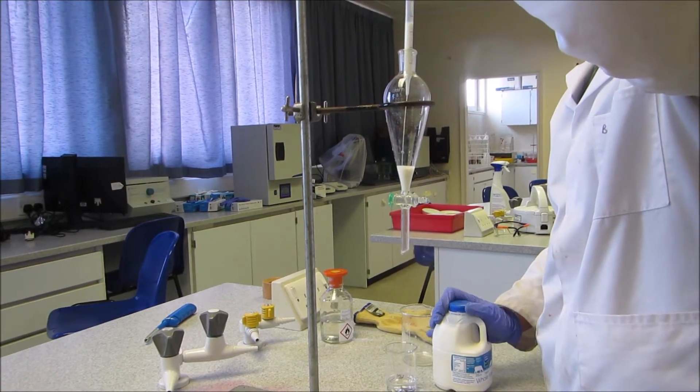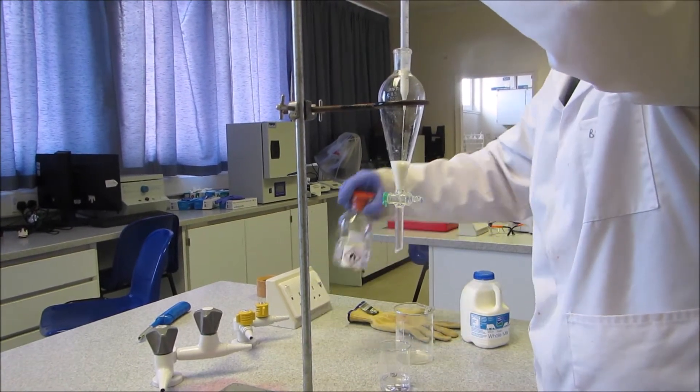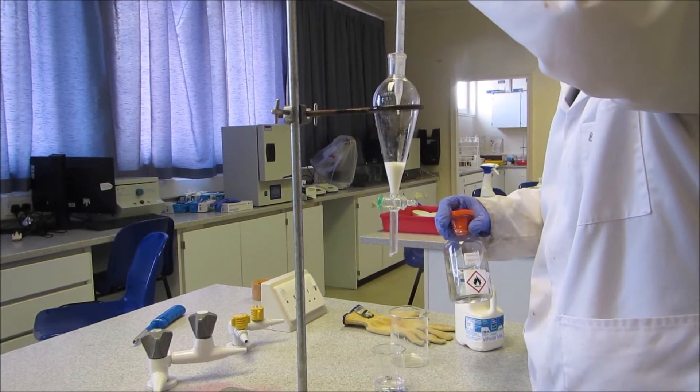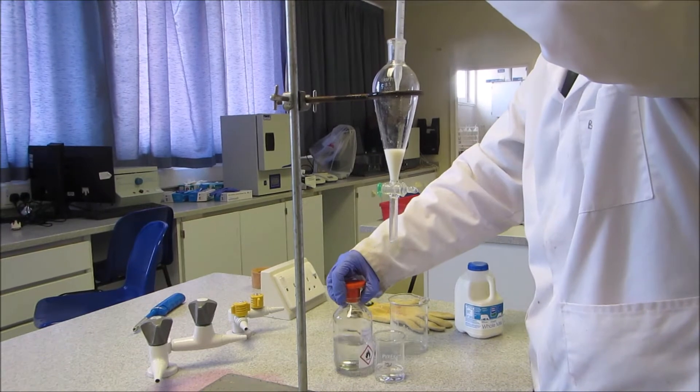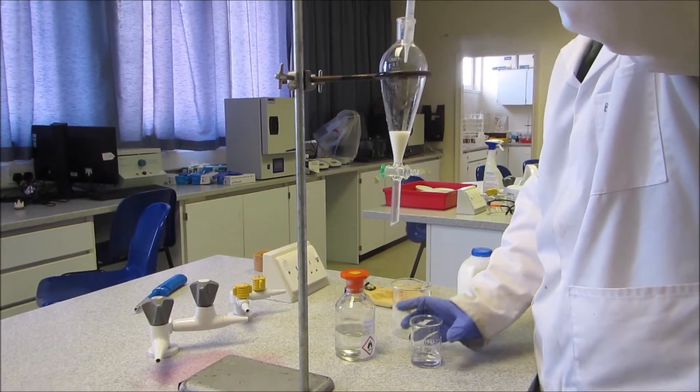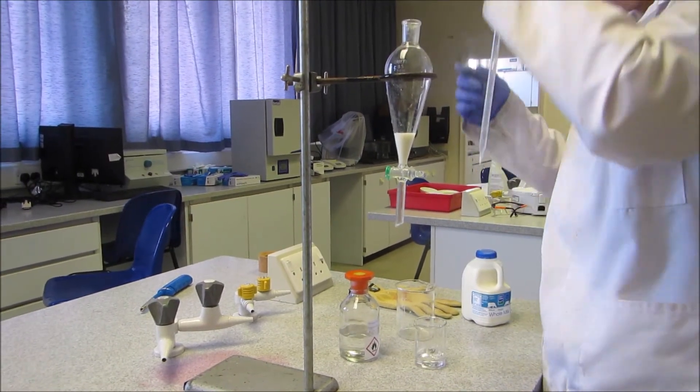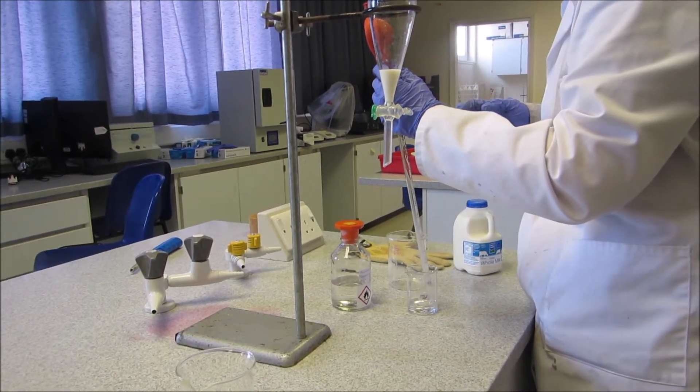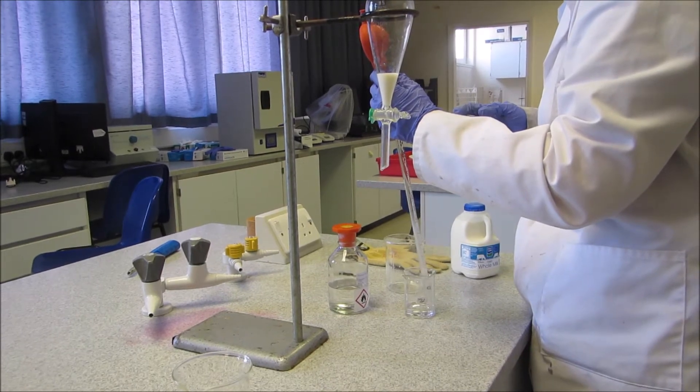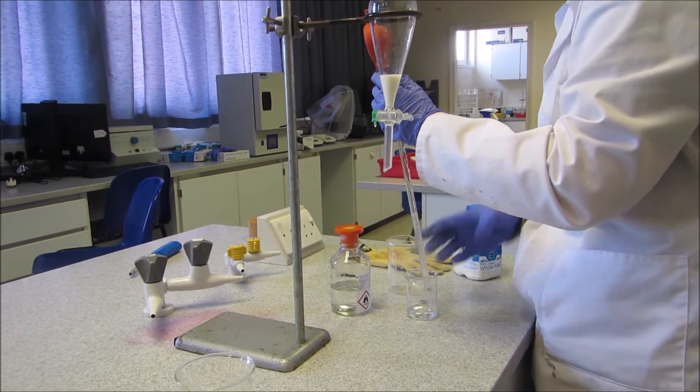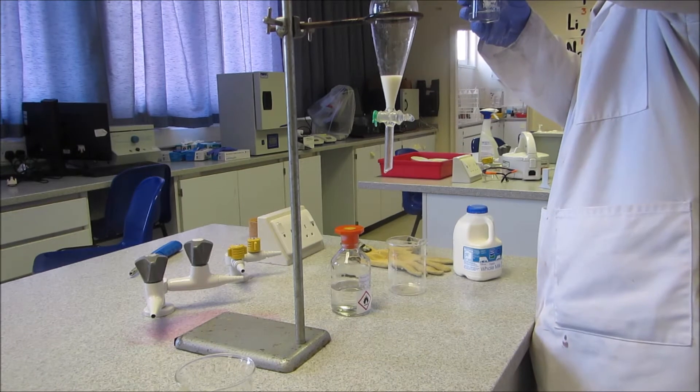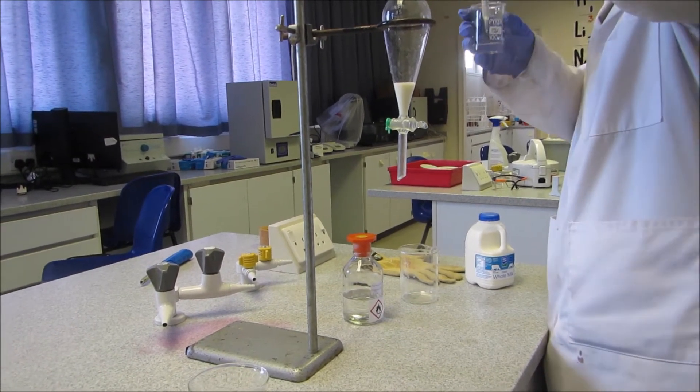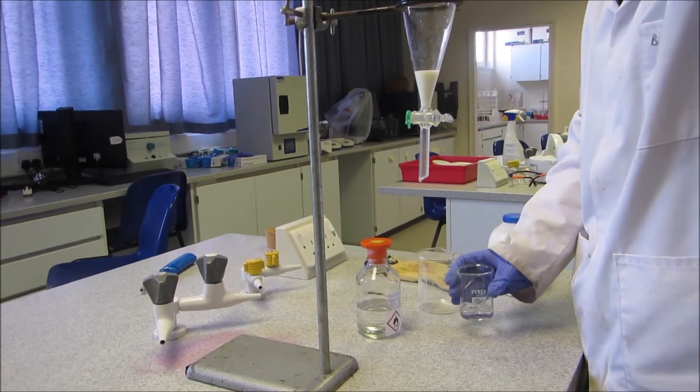So there's a bit of milk left in there, but I've got the solvent that we're going to use, which is a mixture of hexane and isopropanol. I've poured it into a beaker. I want to try and get what's in here out, and as before, I want 7ml of this. I'm going to take it up and just put that in my separating funnel.